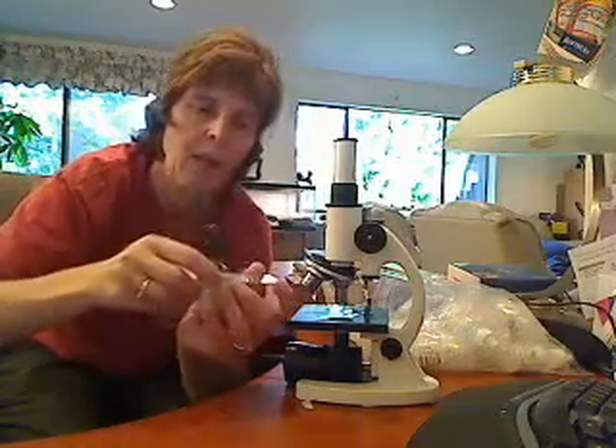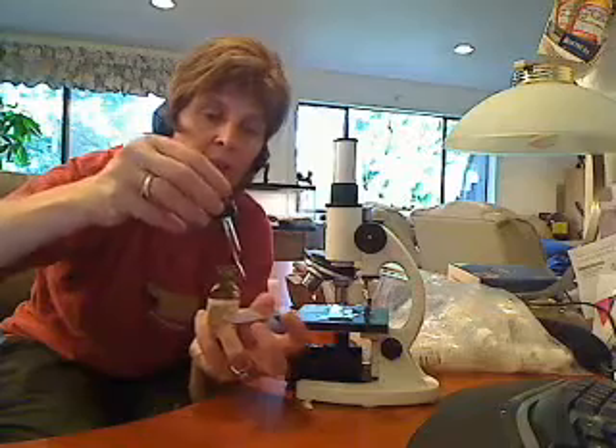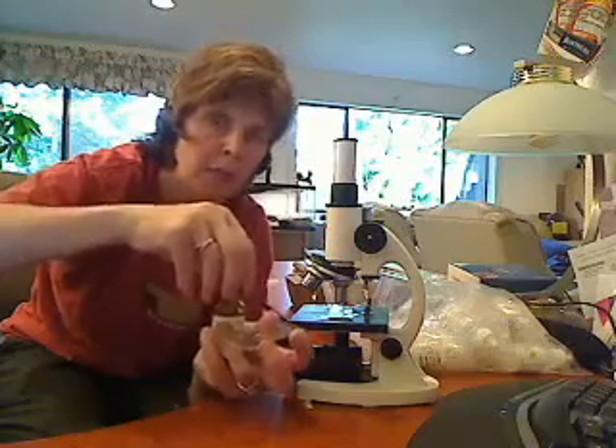Find your iodine. You should have a napkin with this — you notice I don't. You should have one because it will stain if it gets on your fingers. Your skin cells will grow back in time, not to worry — that's just Mrs. P and her silly sense of humor.